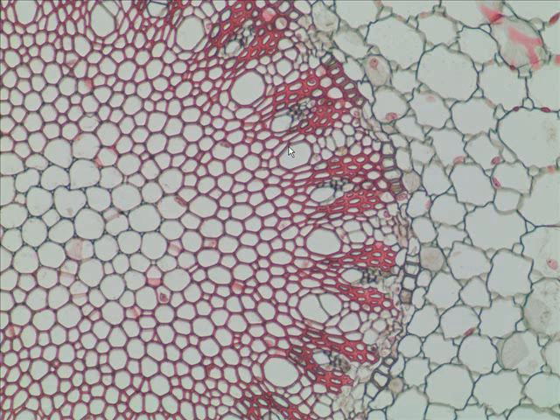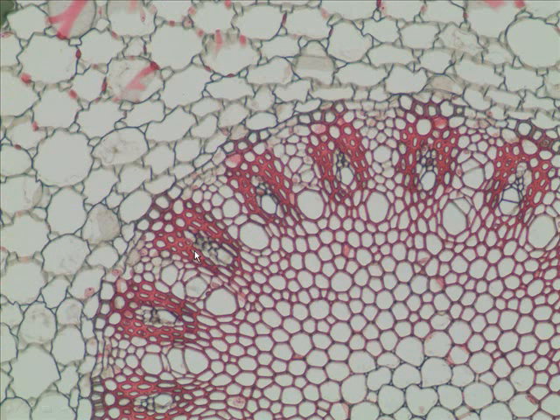Again, these biggest cells are what tissue? Xylem, and we got some smaller xylem cells as well. But in the vicinity of the smaller xylem ones, we have this patch of green stained cells, patch of green, patch of green. What type of tissue is that? Phloem. And here's another look at the same thing.